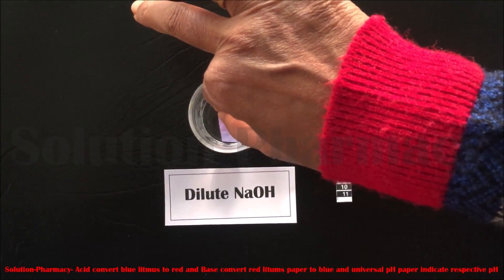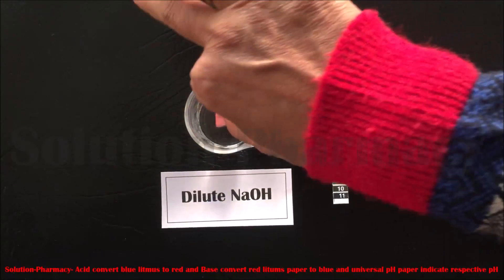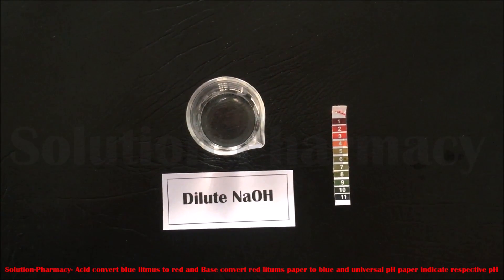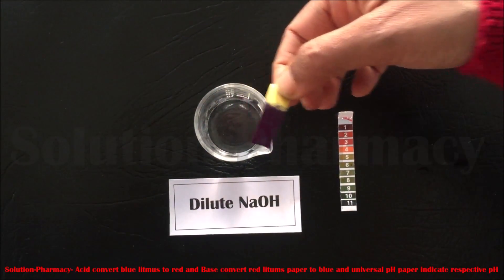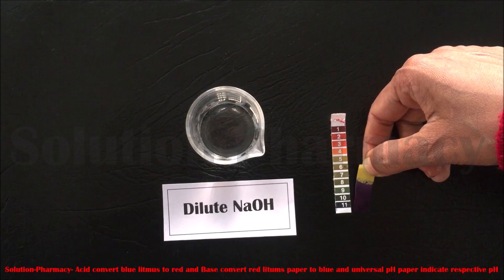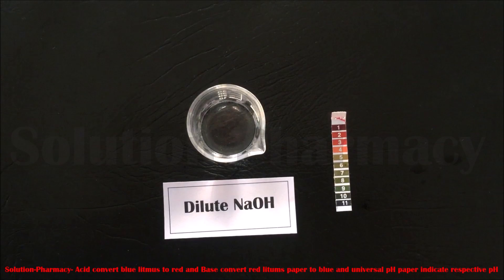The next sample is dilute sodium hydroxide. Dip the blue litmus into it — there is no color change in the blue litmus paper. Now dip the red litmus paper into dilute sodium hydroxide; the red litmus paper changes to blue, which means the solution is basic in nature. Next, dip the universal pH paper into dilute sodium hydroxide. The color changes to a dark purple. When we match this color with the standard pH chart, the color is darker than the value 11, meaning the pH of sodium hydroxide is between 12 to 14.